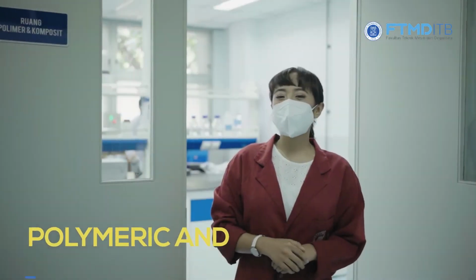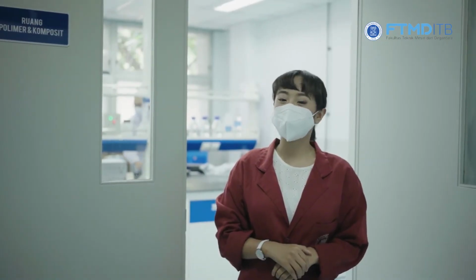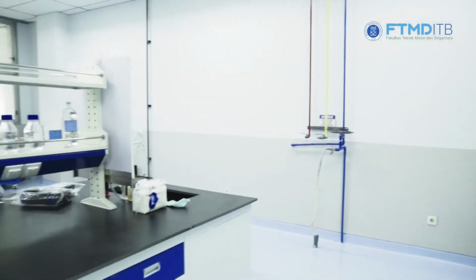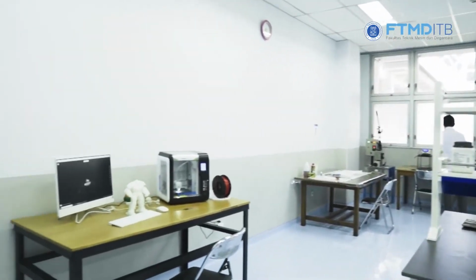Right now, we are in the polymer and composites section, which is part of the materials and metallurgy lab. This lab is located in the main building of the Material Science and Engineering Department. This is our main teaching lab where several polymer and composite machines are used to conduct practicum activities in polymer and composite courses. Through this practicum, students can get a better understanding by hands-on activity in the lab.